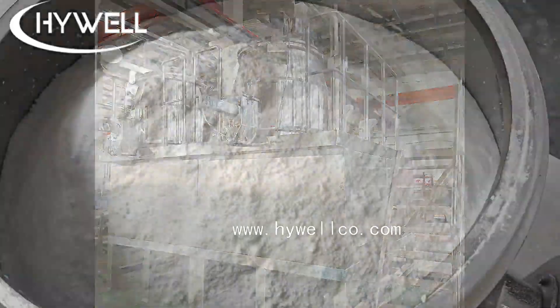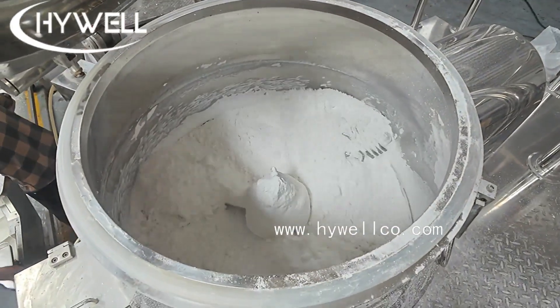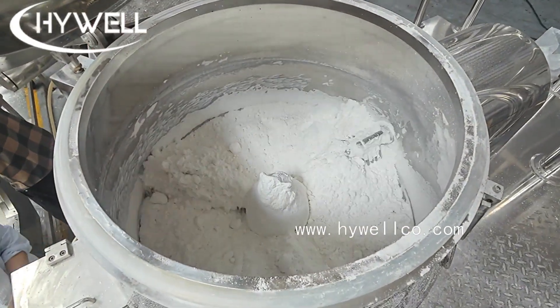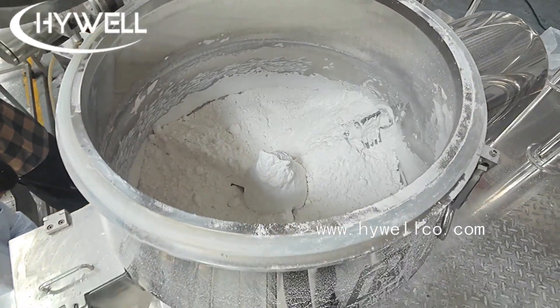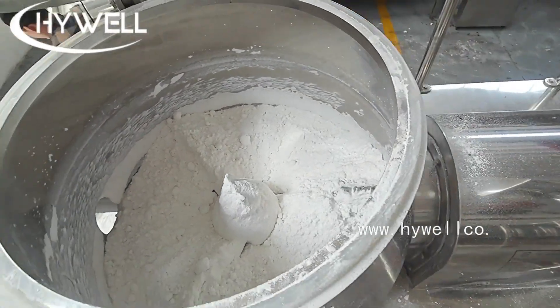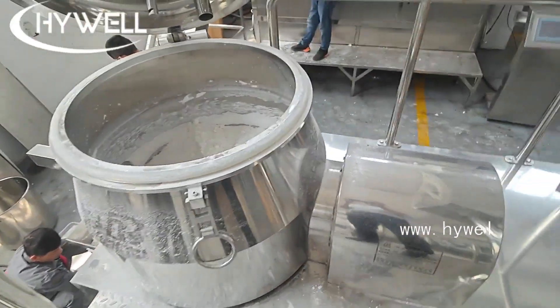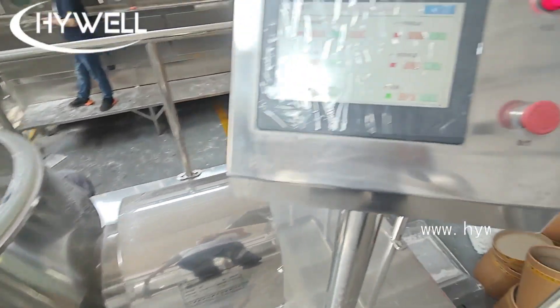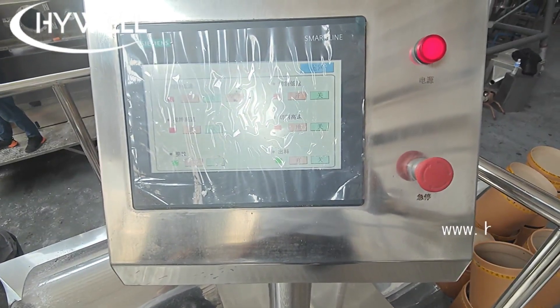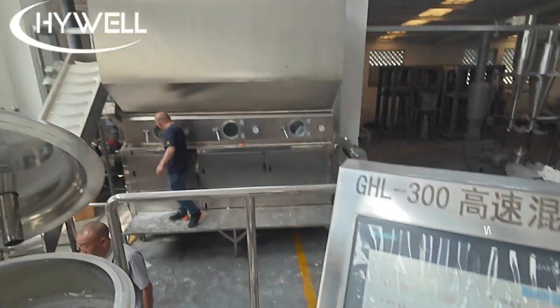The static fluid bed drying machine operates with continuous batch feeding and discharging, with the advantages of adjustable temperature and large output. Since the equipment works statically, its service life is long.